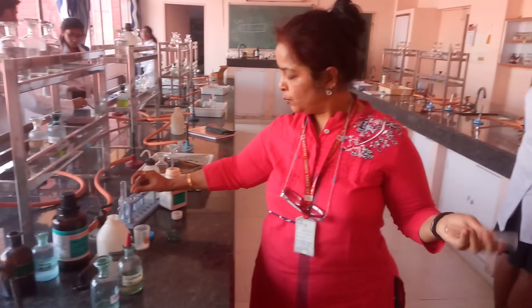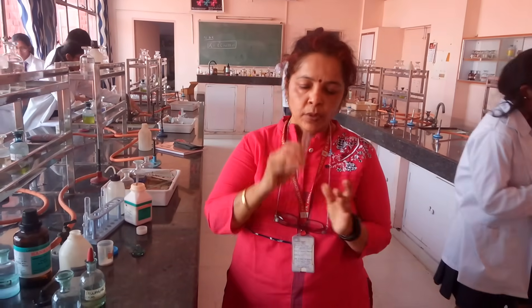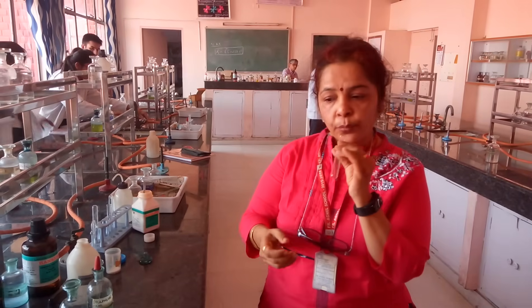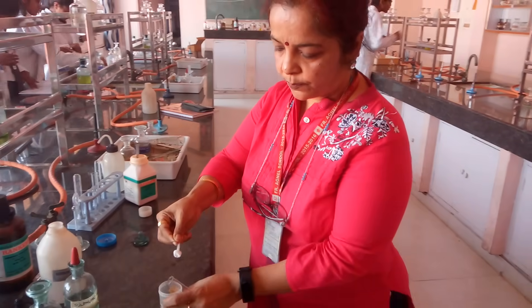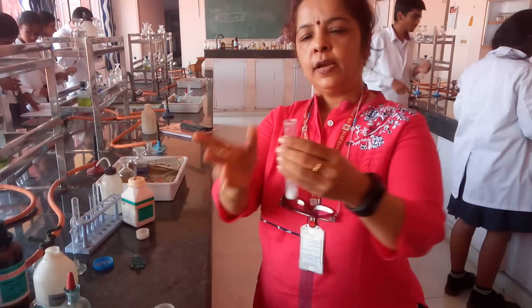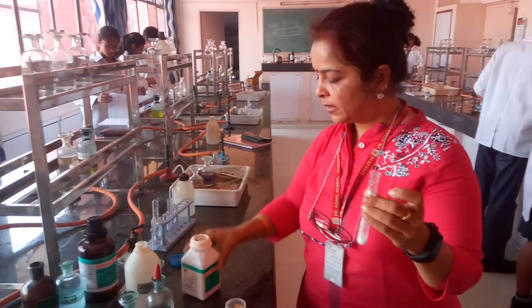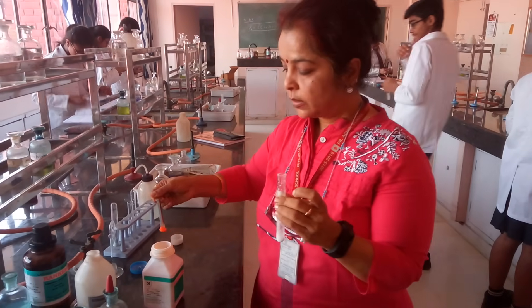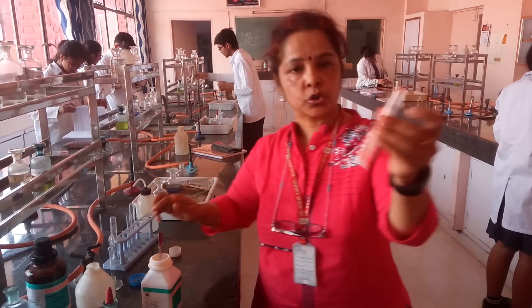Take a fresh test tube and try to dry it as much as possible. In this dry test tube, put the salt given to you. This is a white salt — I am adding it to the test tube. To this salt, you need to add potassium dichromate crystals, which is an orange colored solid. Add potassium dichromate crystals to your salt.